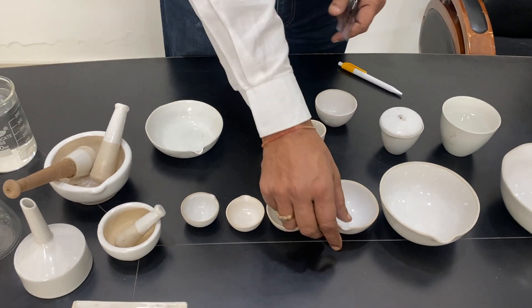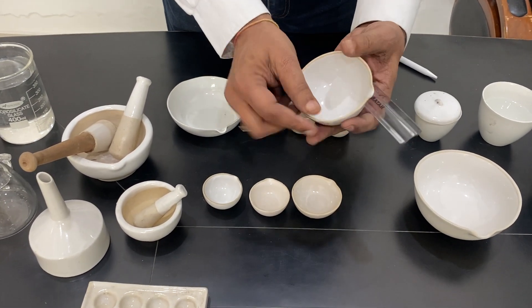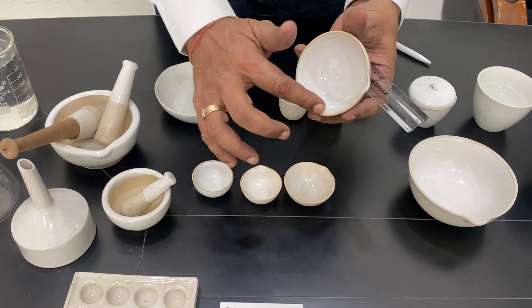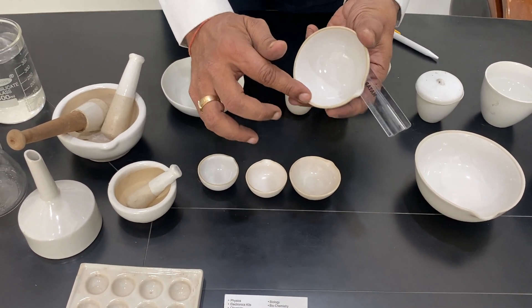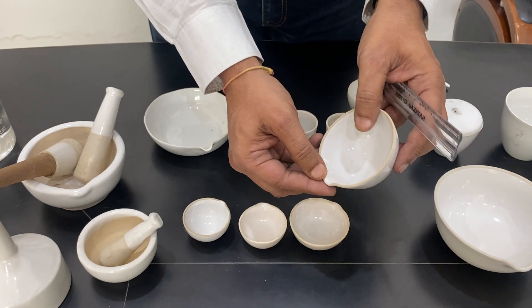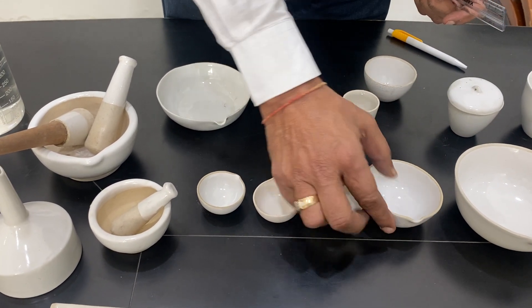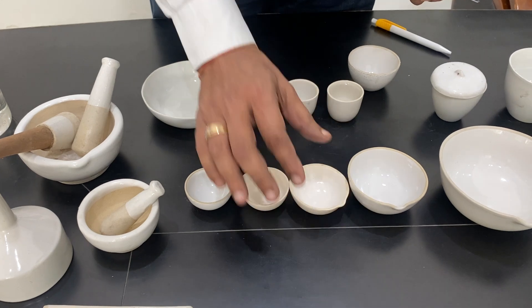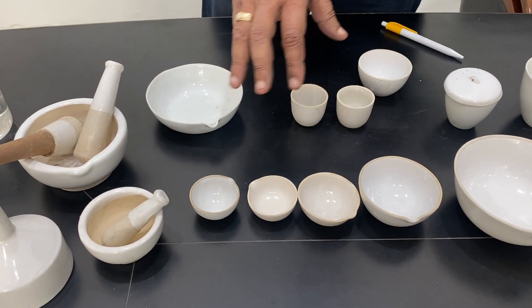These have heavy lips. It has a glazed surface outside, glazed inside, and the lip outer corner is non-glazed. The lip is for pouring. You can make crystals, you can evaporate things, you can autoclave it also, but they are breakable.